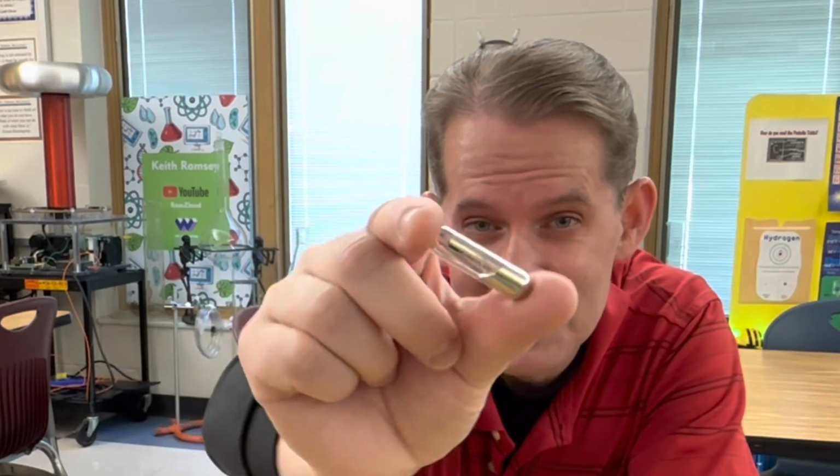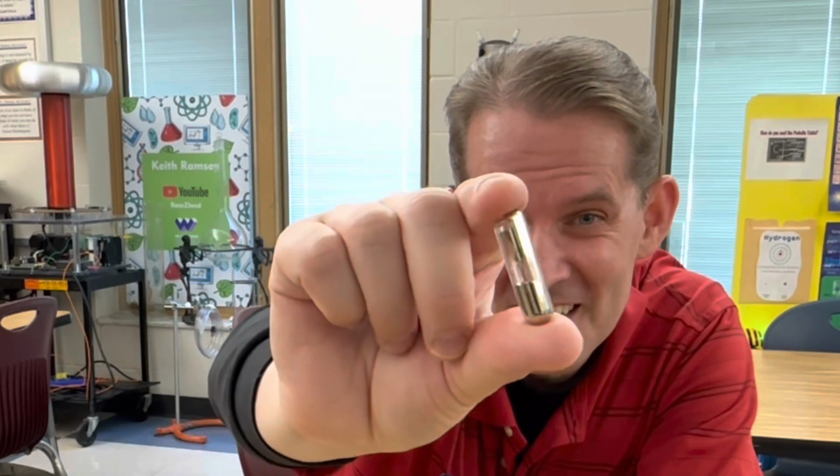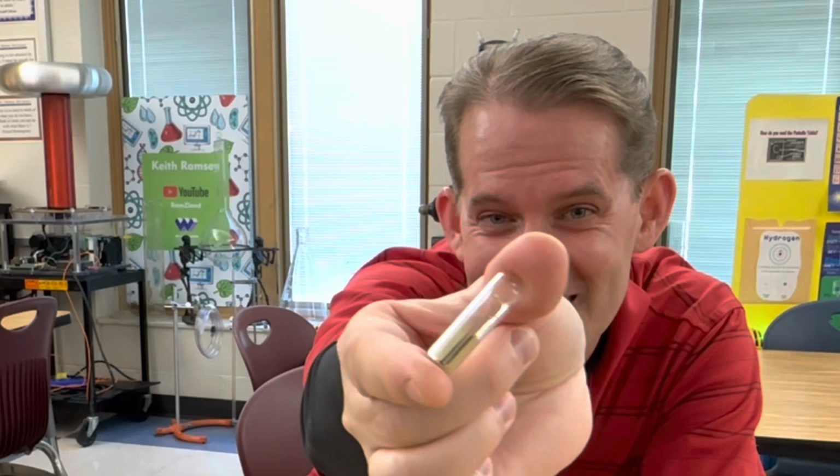And then we're going to put some mineral oil in this container next to me, and that way we can open the ampule safely in the mineral oil, because cesium is extremely hygroscopic and it'll try to absorb water right out of the atmosphere. You can see that it's behaving as a liquid now inside the ampule.